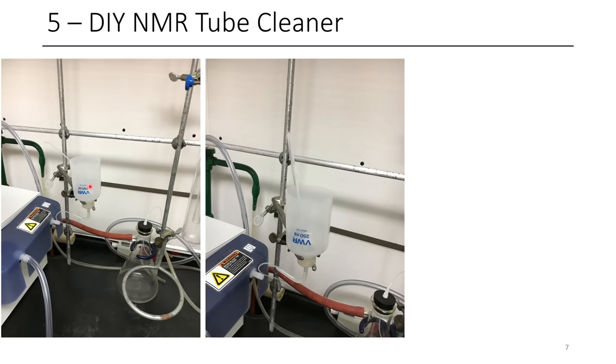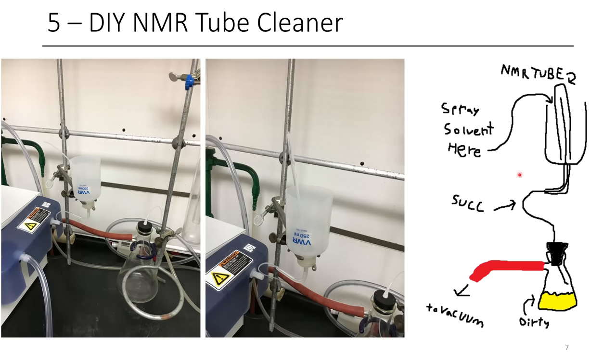So if you put a little bit of solvent in here, as I've shown in this demonstration here, you spray the solvent in here, it gets sucked up around the inside of the NMR tube, and then it goes into the PTFE tubing at the very top, and that sucks it down into the filter flask, which you just have to empty out after you're done.